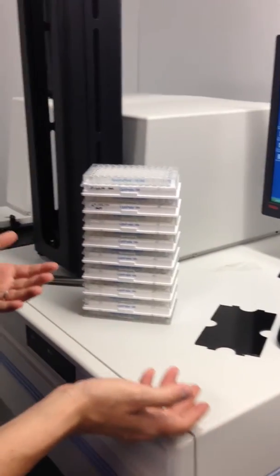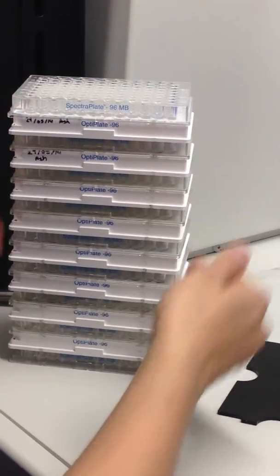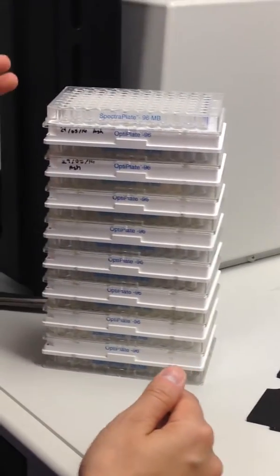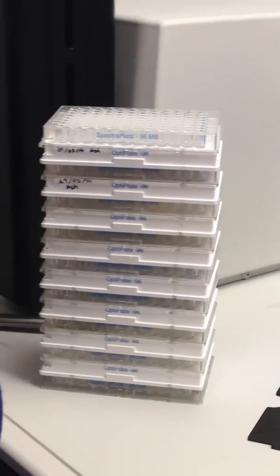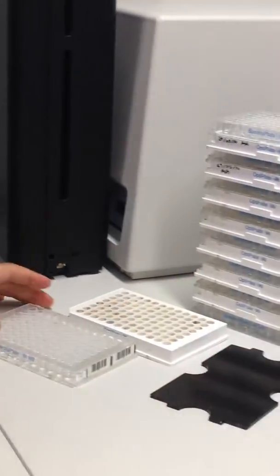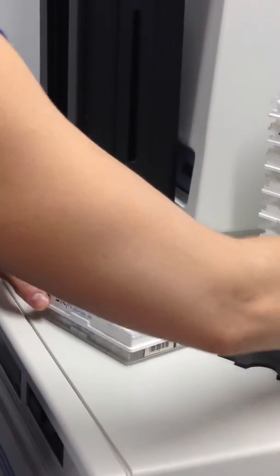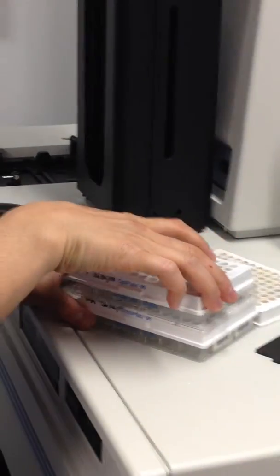Again, this is going to take time, so in the meantime, let's set up your plates. You have only 2 plates to set up. So we're going to have the clear plates, we're going to have fake plates, and we're going to have 6 fake plates, because you only have 2 that you're setting up yourself. When I'm setting up a new experiment, I usually like to put my 2 plates in the beginning. So plate 1, so clear plate, plate 1, clear plate, plate 2. Now your experiment is done, so now we have to put fake plates instead.